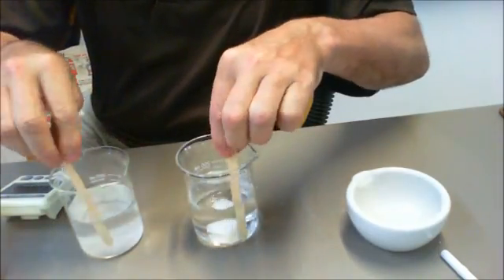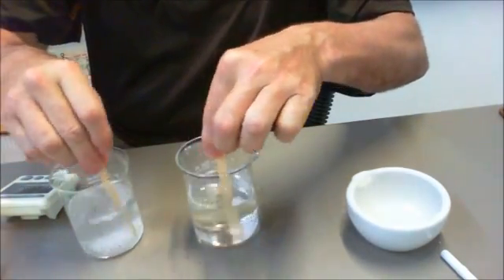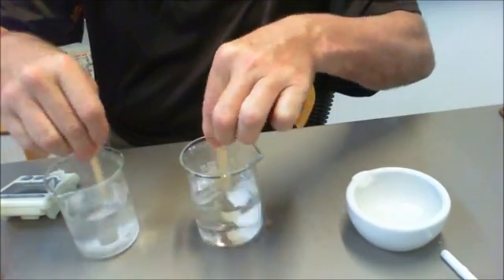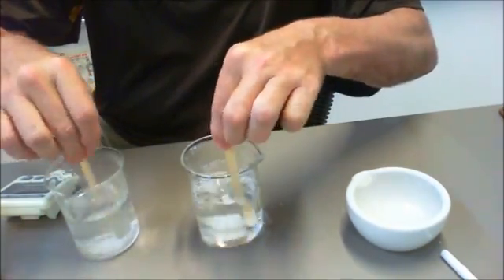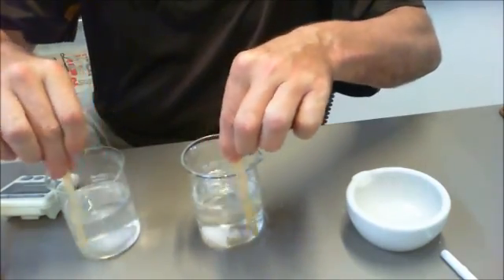And to speed up the reaction because obviously it could take a while, I'm basically just going to stir. Now when you do this you need to make sure that you stir it at about the same rate because otherwise it would be an unfair experiment.